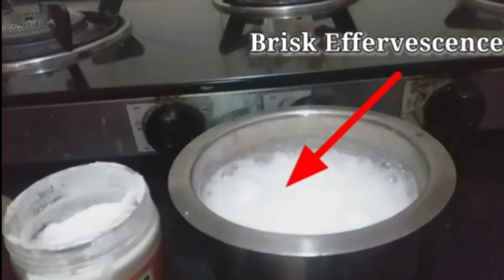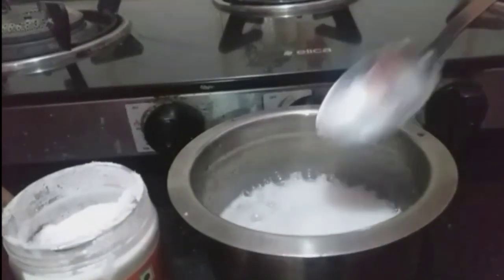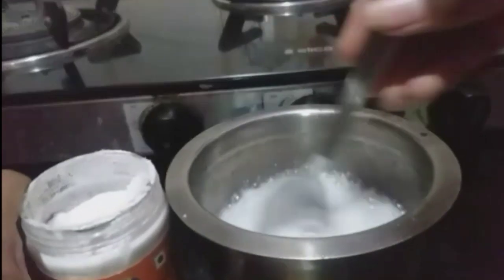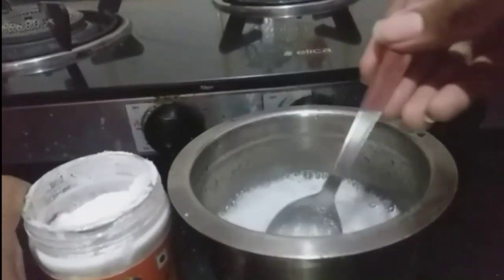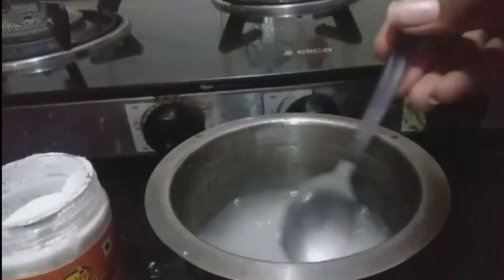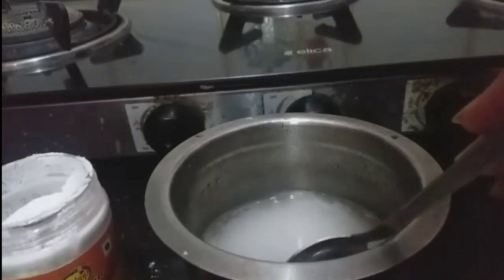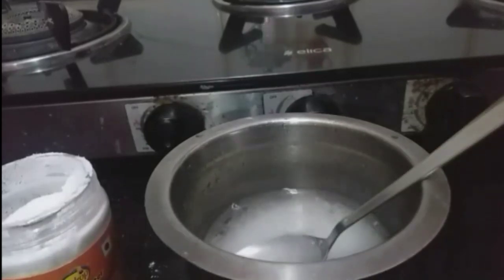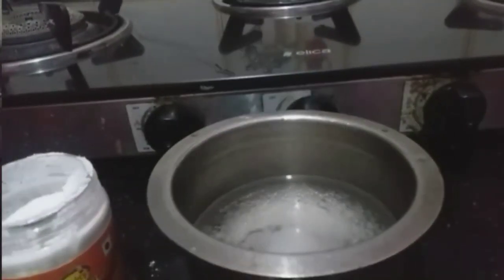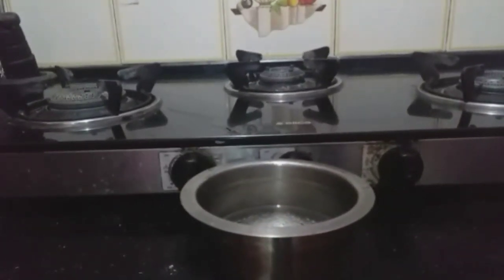Now we will talk about carbon dioxide evolution and the release of gas. There will be brisk effervescence. This is a chemical change — a chemical reaction. The products are sodium acetate and water.